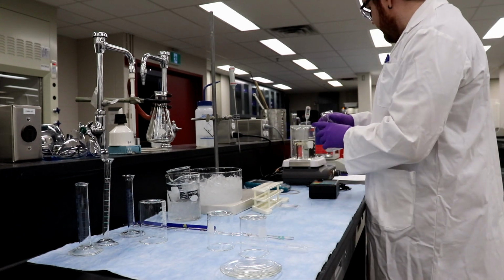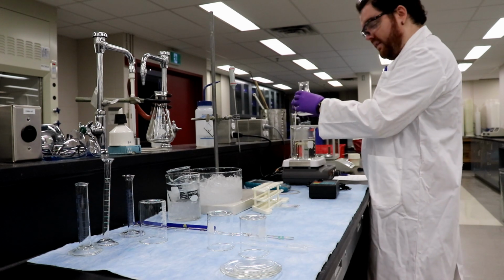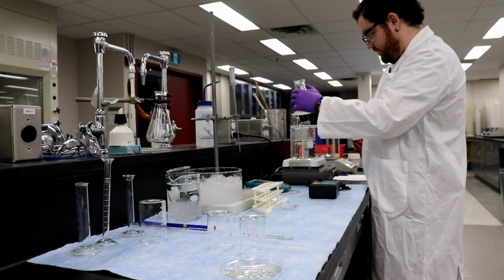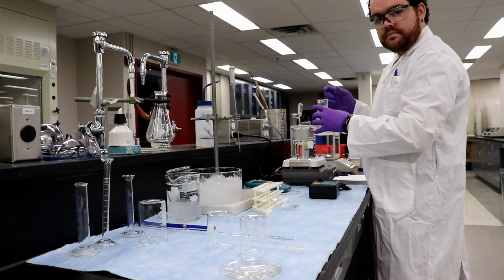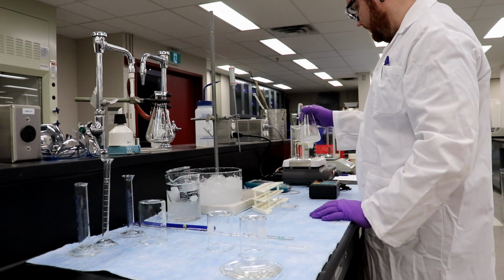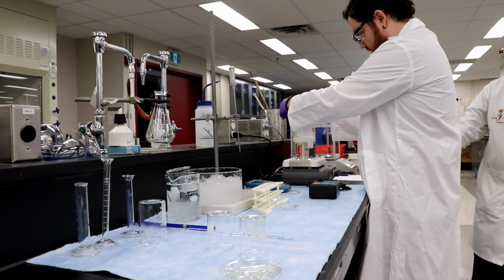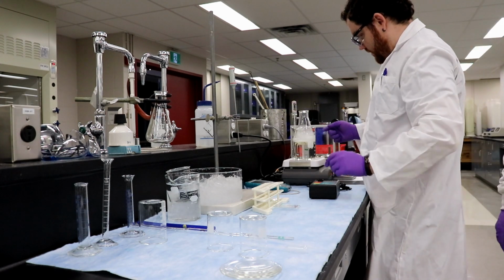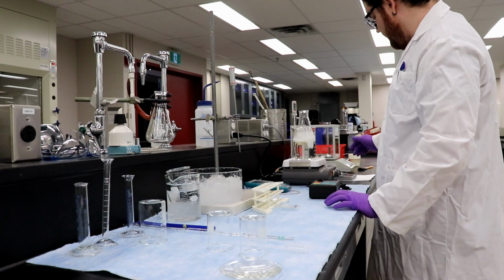So we're at 61 degrees Celsius. We're going to move that guy over there. And 7 minutes? Yes. Do we have a timer? Where did our timer go? Start. Okay. So we have the thermometer right here. We have our thing right here, and we're off to the races.